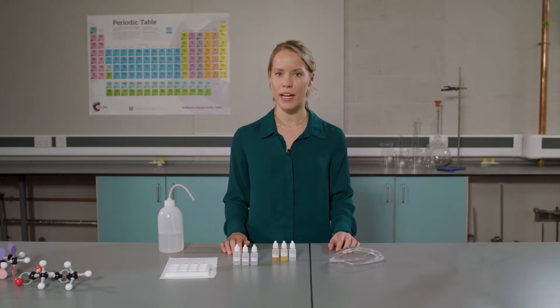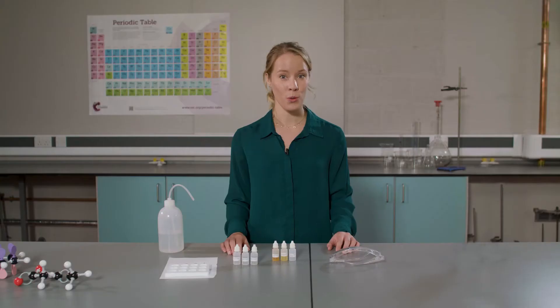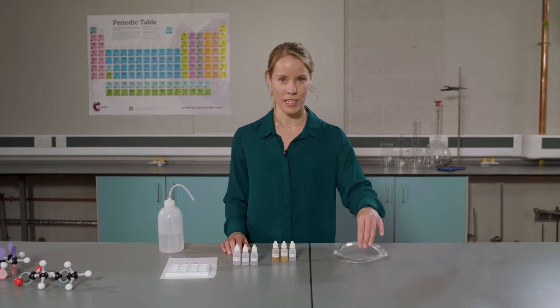Before we begin, let's think about health and safety. Chlorine gas and liquid bromine are both toxic and dangerous to the environment. To minimize this risk, we will be using chlorine water, bromine water and iodine solution. These are aqueous solutions of the halogens. Also, don't forget to put your eye protection on.